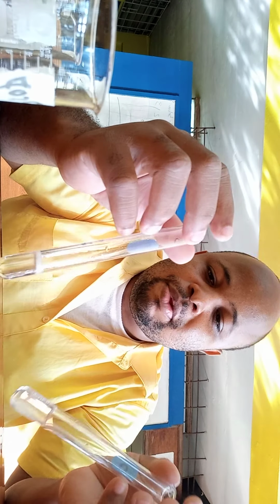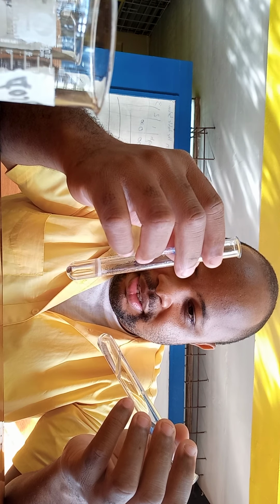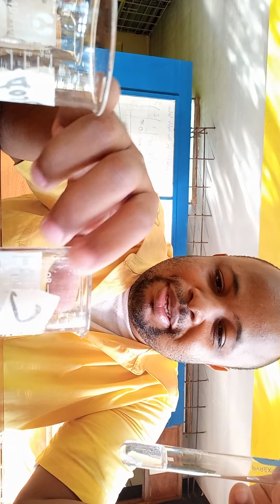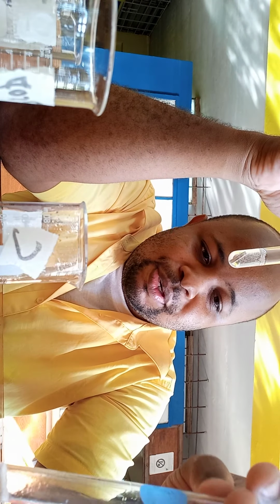So if you were asked to differentiate between primary and secondary alcohol, after the reaction you wouldn't have had any sulfuric acid as the catalyst. So on this I have C, which means, if I did label it correctly and did not mix up anything, this is 1-propanol, the primary alcohol, which is still going on. This one is 2-propanol, which is test tube A. Alright, it reacted much faster. I'm assuming it has more of the acid, the sulfuric acid, which is strong. Alright, this is just me assuming.